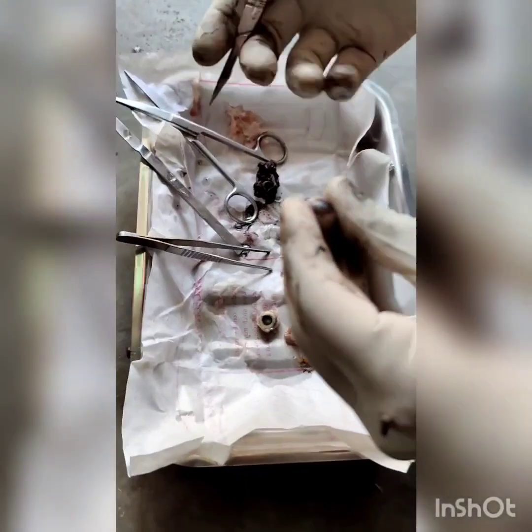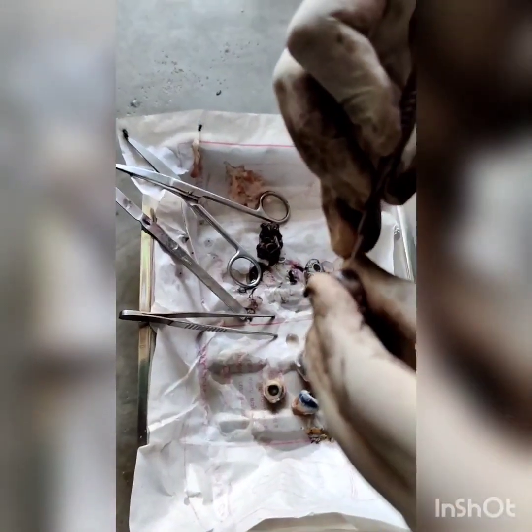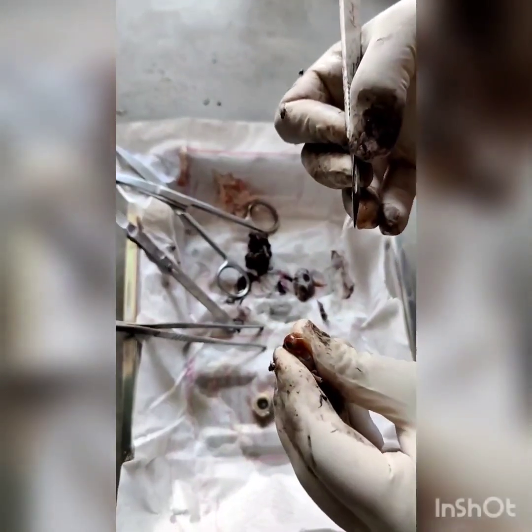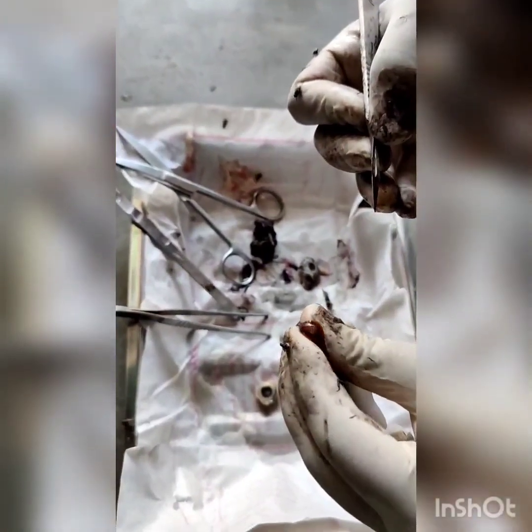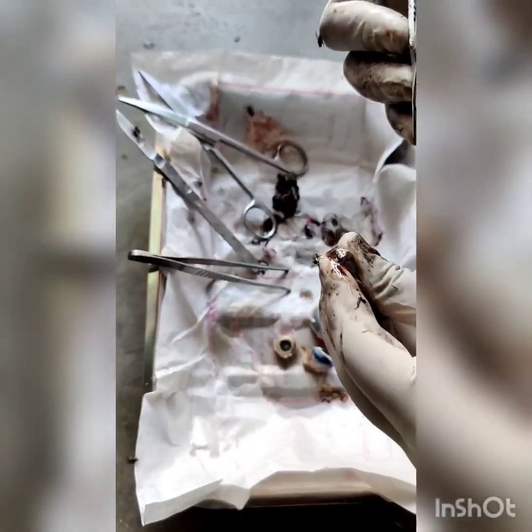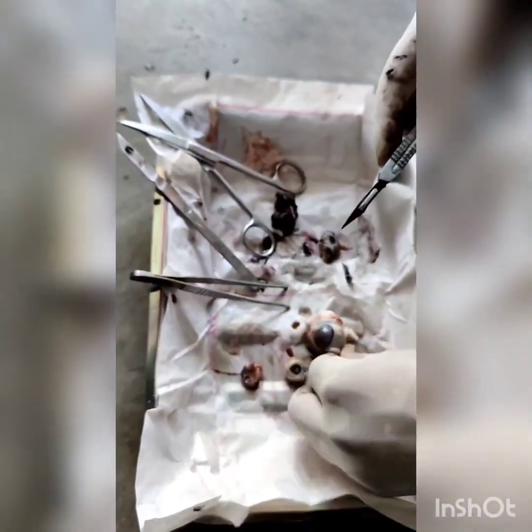Puncturing the fish eye to make the lens visible — the fish eye contains a yellowish fluid. Now I will try to tear out the lens.